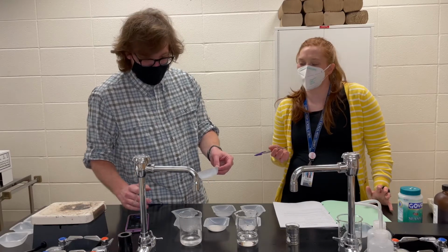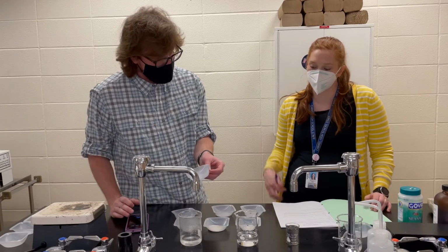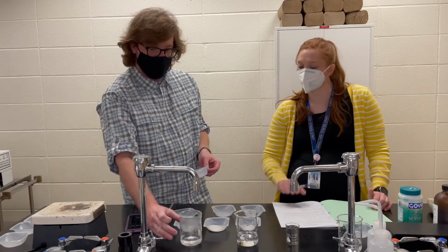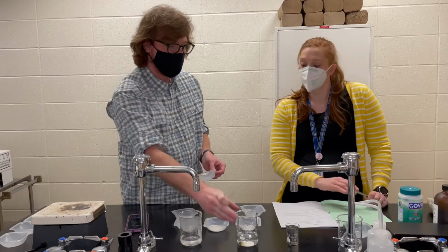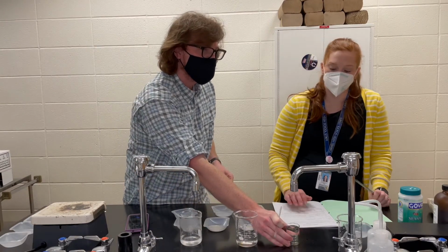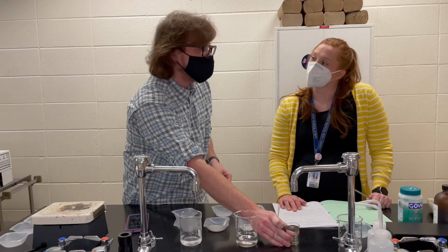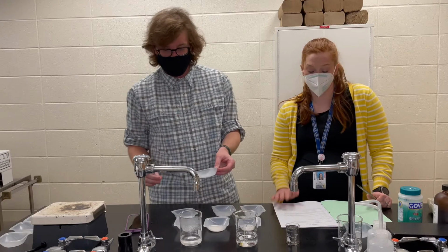I just realized we don't have a thermometer to take our actual temperatures, so we're gonna estimate here that this one's about at 95 degrees Celsius. We're gonna call this one about 25 degrees Celsius because it is a little warm in the classroom today, and then we'll call this one probably about, what do you think? 15? Okay, so those are our 3 different temperatures of water.